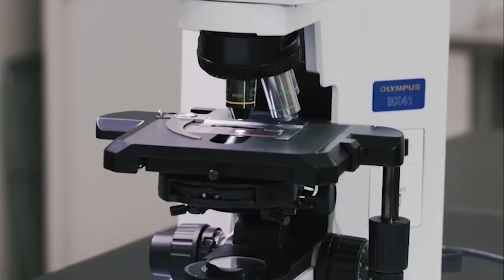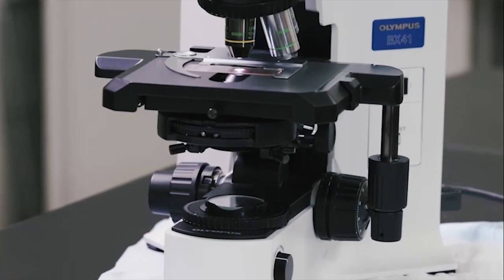In this video we are going to talk about setting Kohler illumination for your microscope.